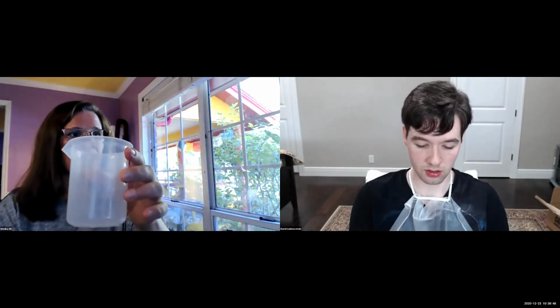And so if you use this container, Daryl, and take one of the empty plastic bags and put it in here, that's a nice container to put your contaminated loops and your contaminated cultures in if you don't need them anymore. Perfect. So I always have a container on my workstation to put contaminated materials in. Okay, and I just found the Bunsen burner. In case anyone was wondering, it's wrapped in the brown paper.